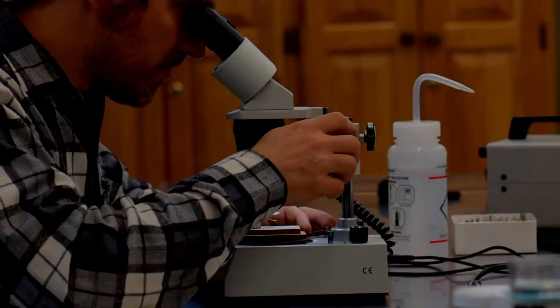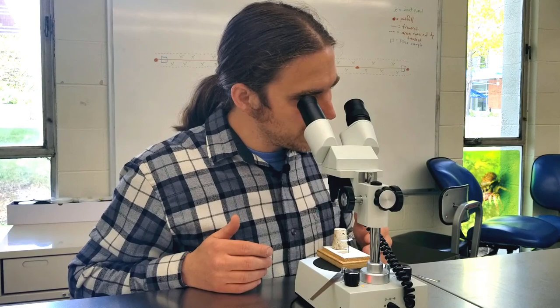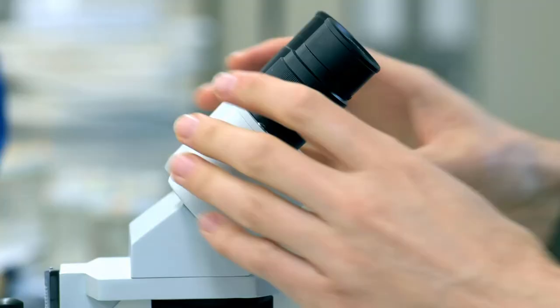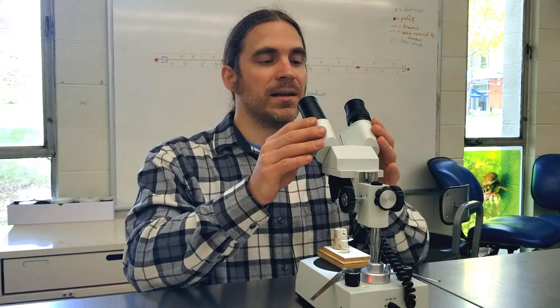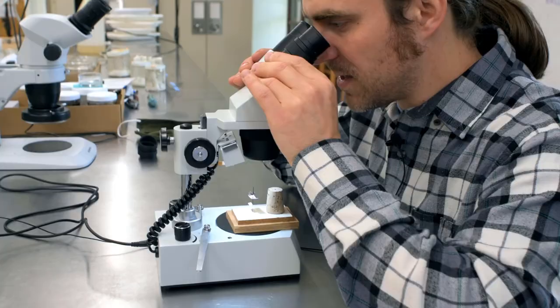One of the most common issues I encounter with students using microscopes is that they can only see through one eyepiece — they'll be squinting and looking from the side. The eyepieces can be adjusted in and out, since people have different eye widths. If the person before you had much wider or narrower eyes, the eyepieces may be adjusted for them but not for you. In this case, these eyepieces are too wide for my face, so I adjust them in until I can see through both eyes.